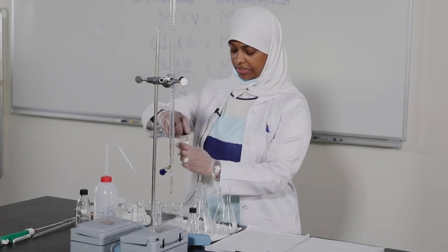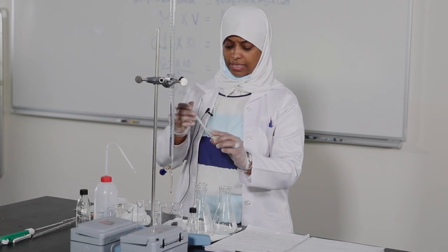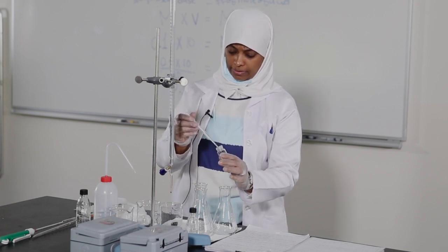We use the indicator in every flask — only three drops.